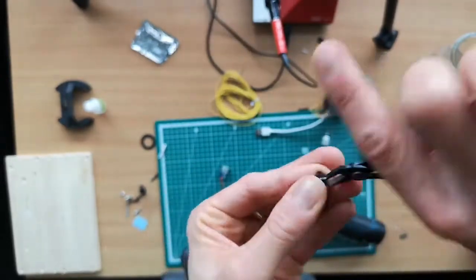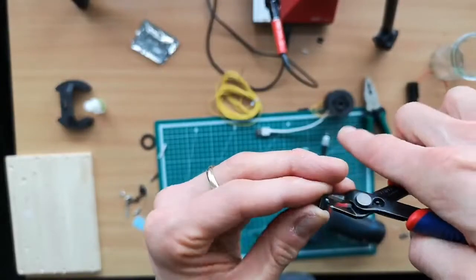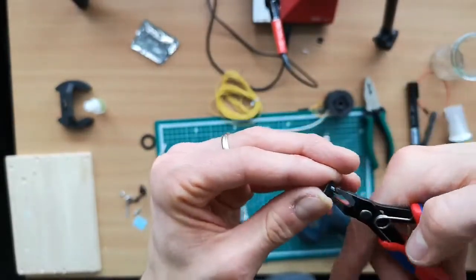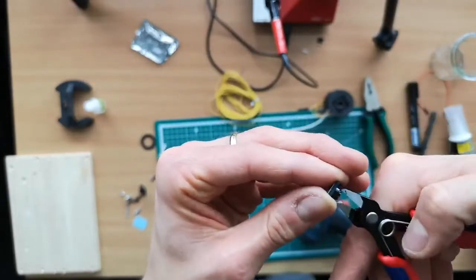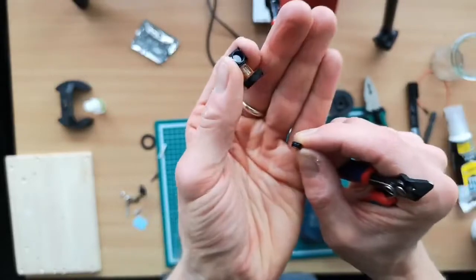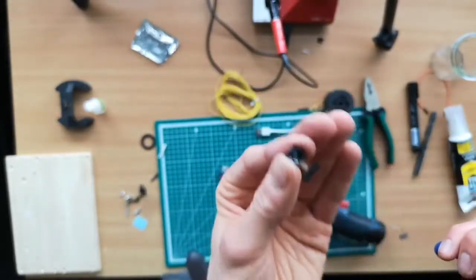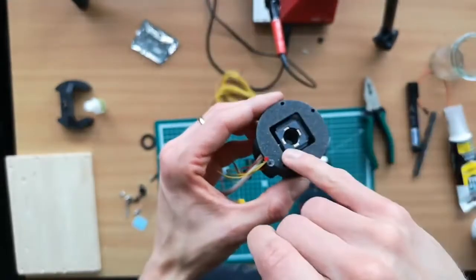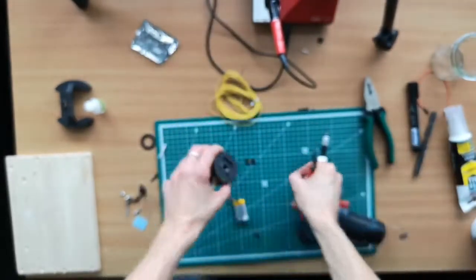And once... so you see it has a small threading and it's going inside here. And so this step had to be done beforehand, of course. So what we have to do now is adapting this lens into this M12 adapter, and then we are pretty much done.